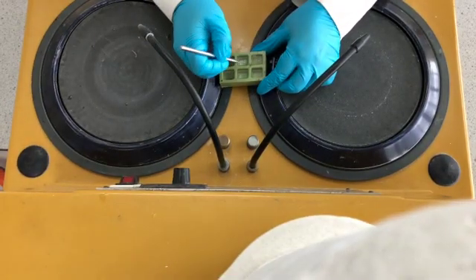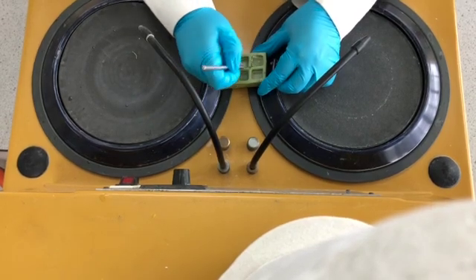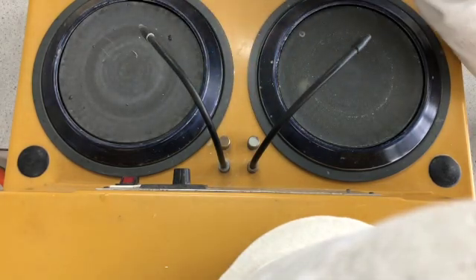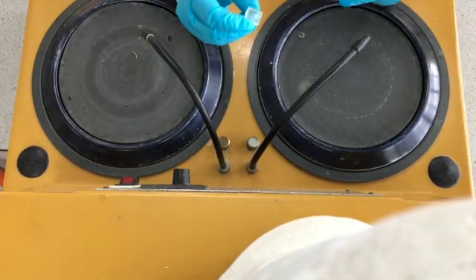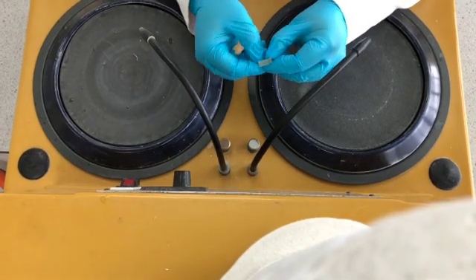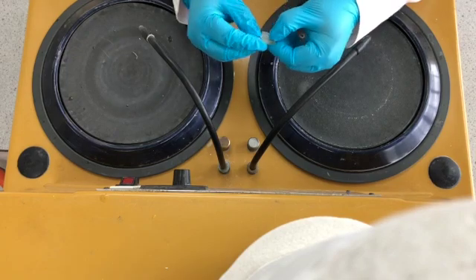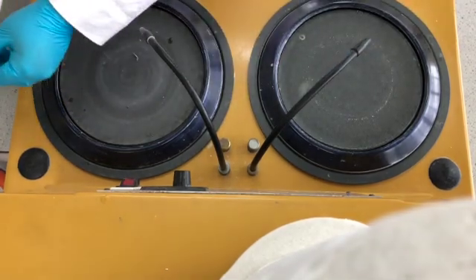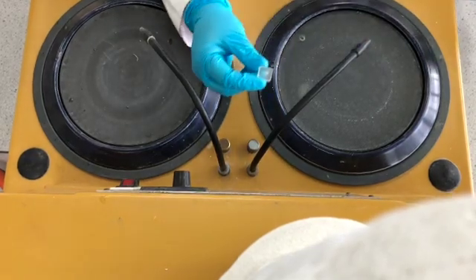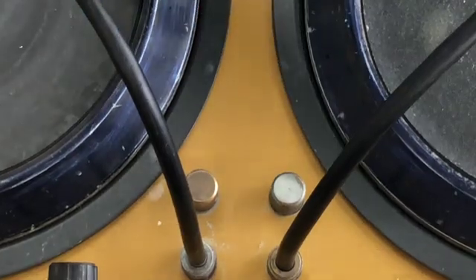We are removing the cross section that we prepared. The adhesive with the paint particle is sandwiched between the two layers of adhesive. You can just see the paint particle in between the two pieces of adhesive and they are stuck together. At this point I'm just removing the excess adhesive, so have a look and you will see the small paint sample embedded in the adhesive.